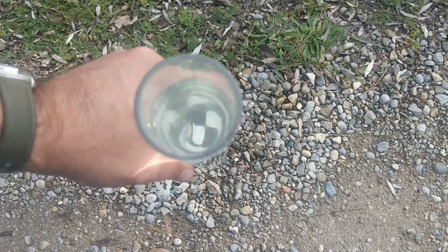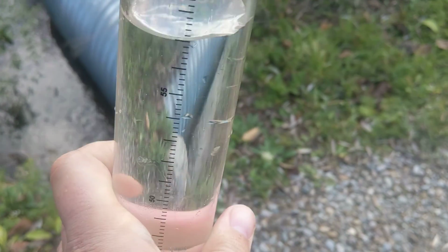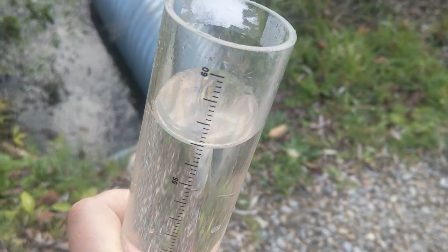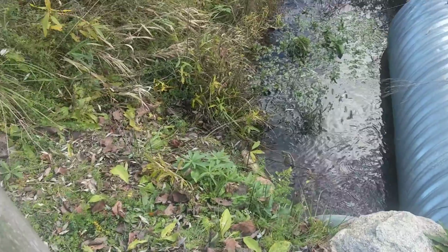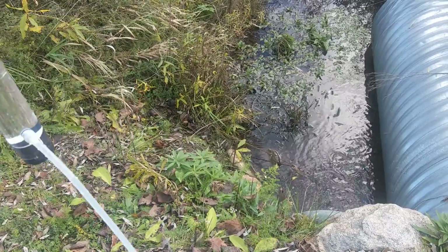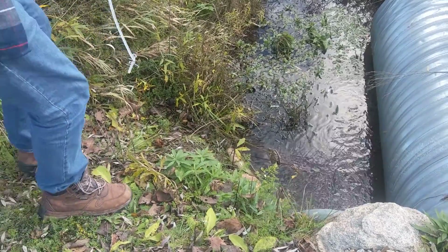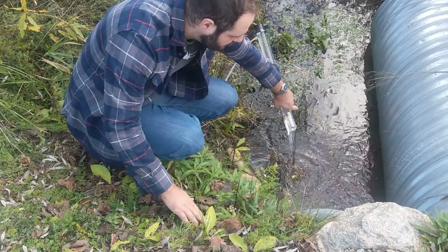So if there's a lot of silt, you won't see the pattern. So this is actually above 55-60 centimeters, the turbidity here, which is actually very good. But let's stir things up and see if we can get an artificially increased value, just to show you what it might be in some other ponds or streams that you might be in.